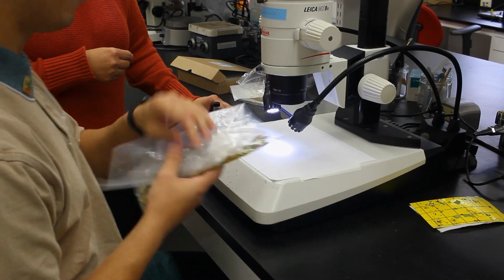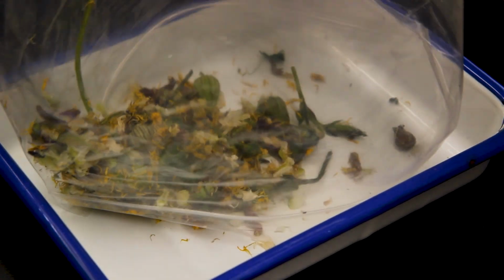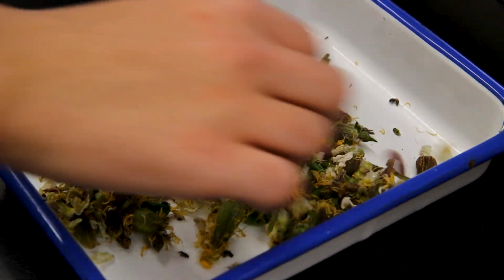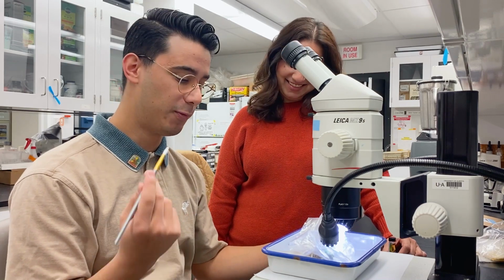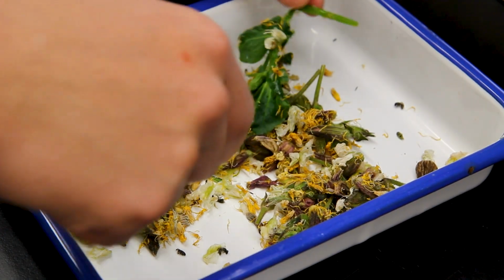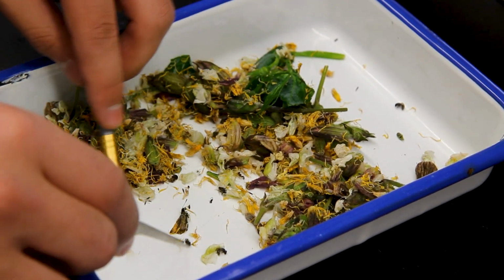Once we have this, we can take a nice little tray that we have here. We dump the contents of our sweep net sample into the tray. We put the tray underneath the microscope. We take our trusty paintbrush, which is really good for separating out insects from the plant. I know it's not exactly a very scientific tool, but it gets the job done. So we'll dump everything in there, we'll sort everything out, and sort of like what we do with the sticky cards, we want to keep track of what insects we find.